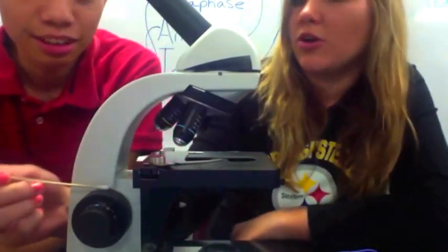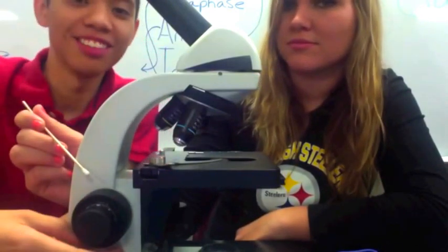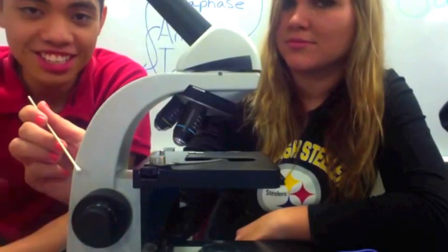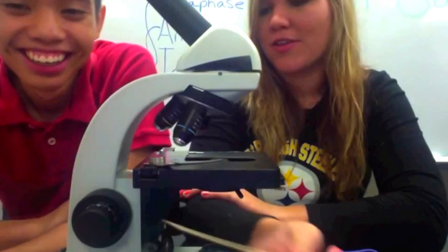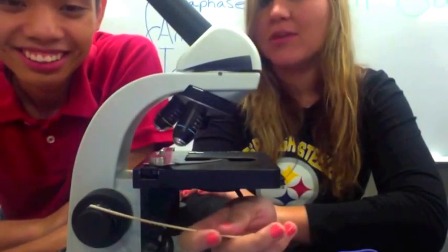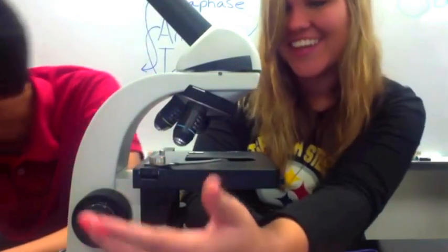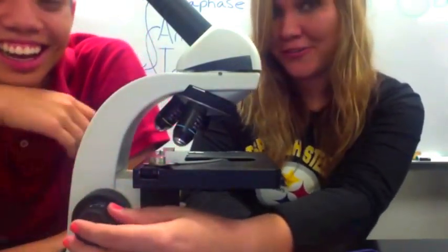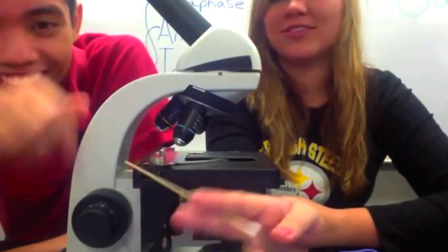These knobs over here: the big one is called the coarse adjustment knob, and the small one is called the fine adjustment knob. The way I remember the difference is: if you say someone has fine hair, their hair is really thin and small. So the fine adjustment knob is the small knob. That's what worked for me on the lab exam because I got these two confused all the time.